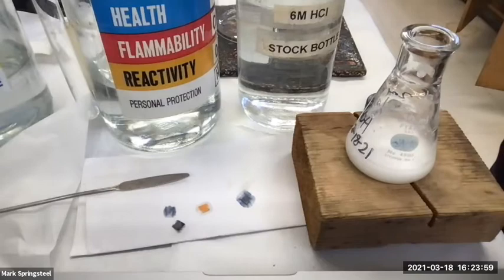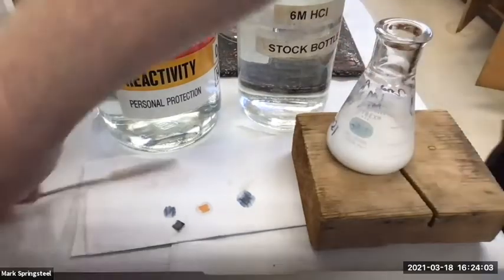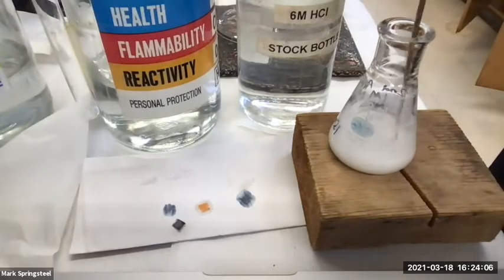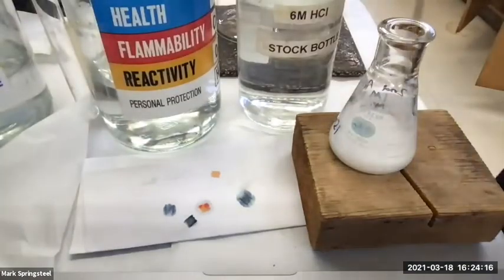Let's do another good squirt. Give it a swirl. Looks like it got a little whiter, a little more precipitate formed. It's not always the best to use the same piece of filter paper, but I mean pH paper. But it looked like it did get pink, but I'll get a fresh one to confirm.